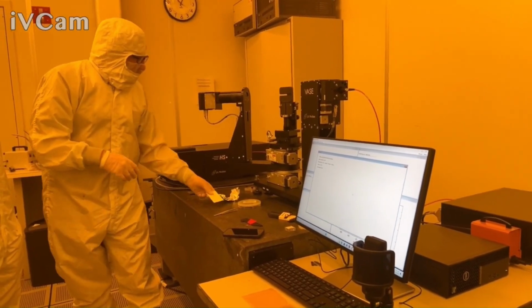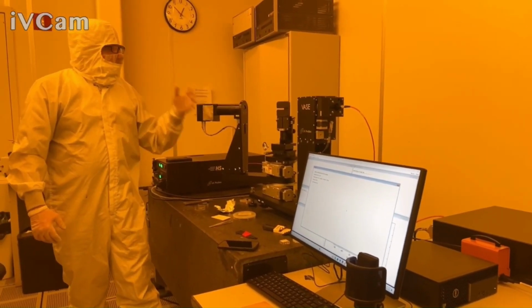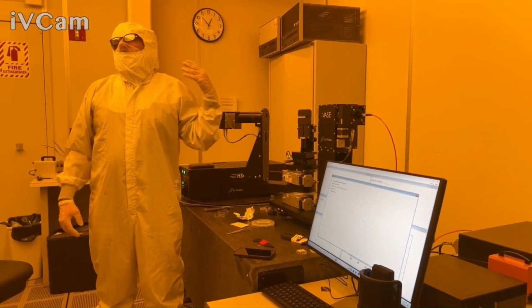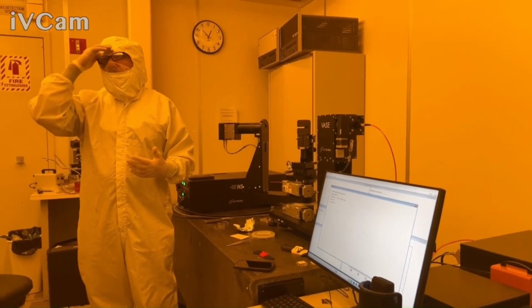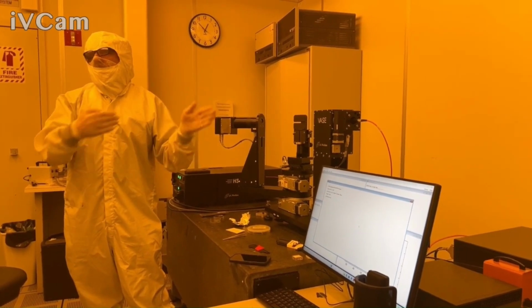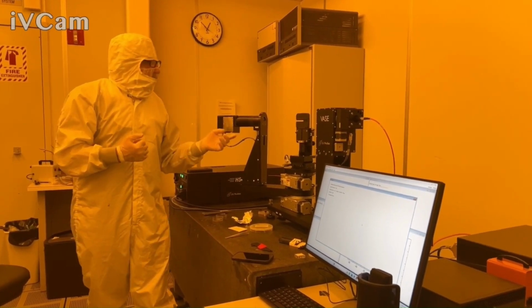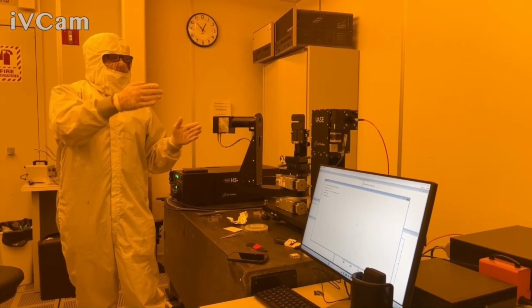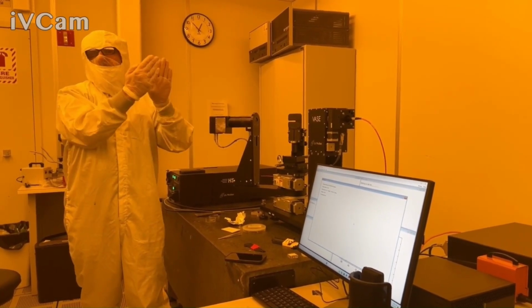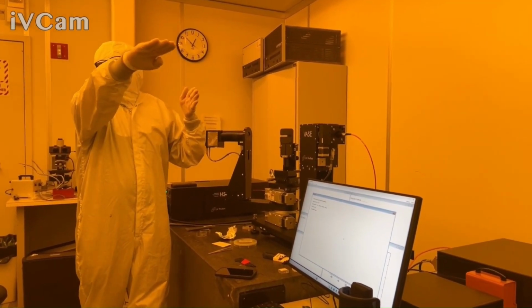Especially if you're doing a lot of transmission intensity work, you have to measure a baseline measurement. When we do reflectance in a little bit, we won't really be doing this because we're going to be coming off at an angle. A baseline is basically a no sample measurement. What does air look like at these wavelengths? What does your sample look like at these wavelengths? And figure out what the transmission is. One of the tricks we use, because of drift of the lamp and everything else, is interleaving, which goes back and forth, taking only chunks at a time. What's the air look like? What's the sample look like? So we're not measuring the full spectrum in case something drifts.